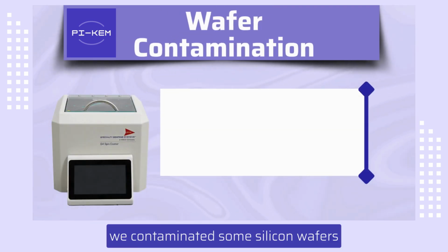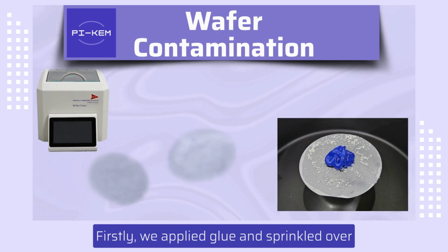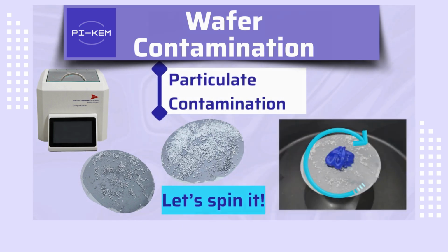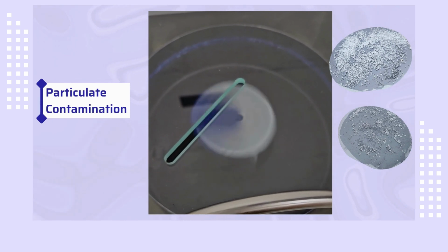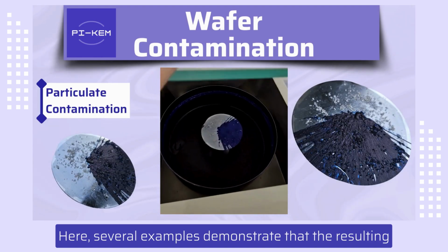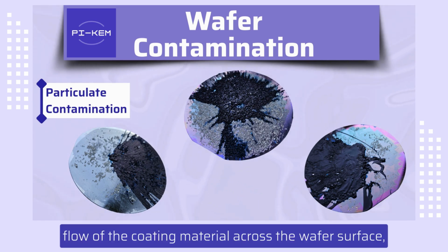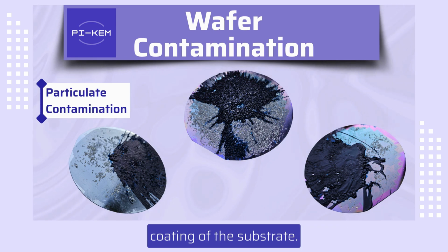To demonstrate this, we contaminated some silicon wafers in a number of different ways. Firstly, we applied glue and sprinkled over coarse salt to varying levels. This represents particulate contamination of the wafer surface. Here, several examples demonstrate that the resulting coating is not uniform nor consistent across the substrate surface. The contamination impeded the flow of the coating material across the wafer surface, resulting in an uneven and incomplete coating of the substrate.